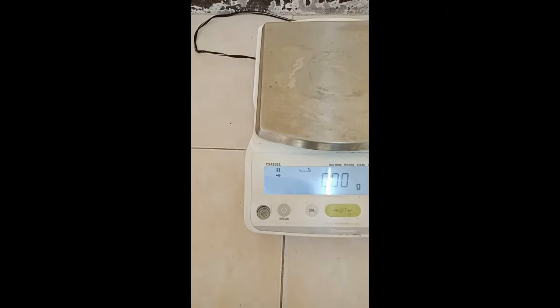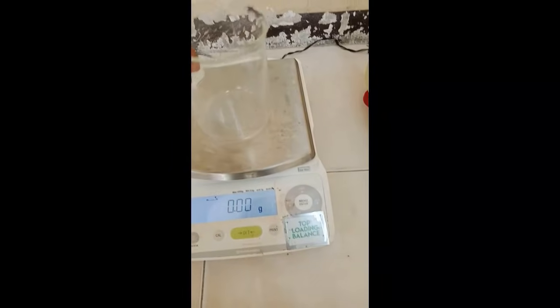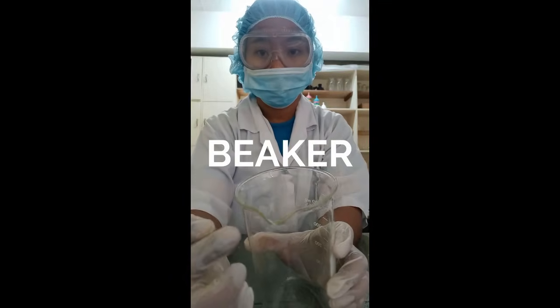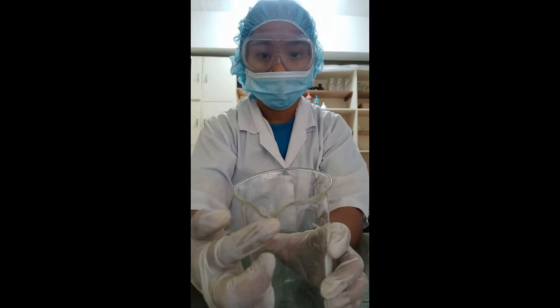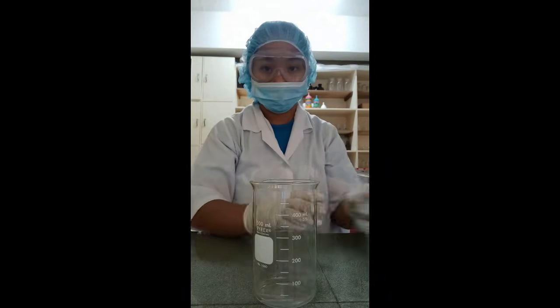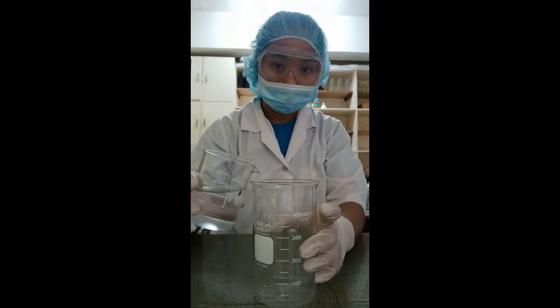Balance. It is used for accurate weighing of samples and precipitates. Beaker. It is a common container used for mixing, stirring, and heating chemicals. It has spouts on its rim to aid in pouring, and it comes in a wide range of sizes.